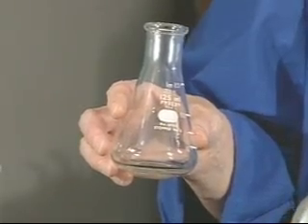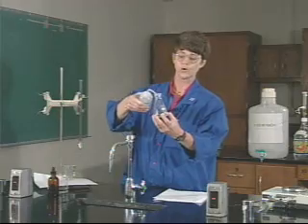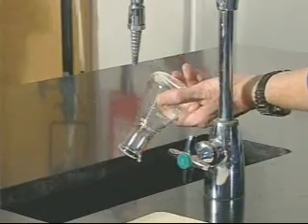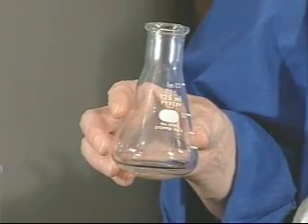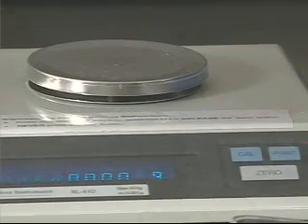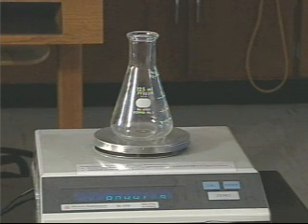The Erlenmeyer flask is what's going to hold the vinegar sample that we're going to titrate. The flask should be dry on the outside, and it's a good idea to do a couple of rinses with distilled water first — do a second rinse and discard the water. The flask does not have to be dry on the inside because you're going to add water to it a little bit later. After you've rinsed the Erlenmeyer flask, get the weight of the flask: zero the balance, place the Erlenmeyer flask on the balance, and record the weight to three decimal places.